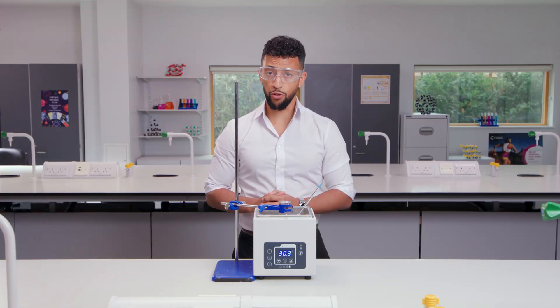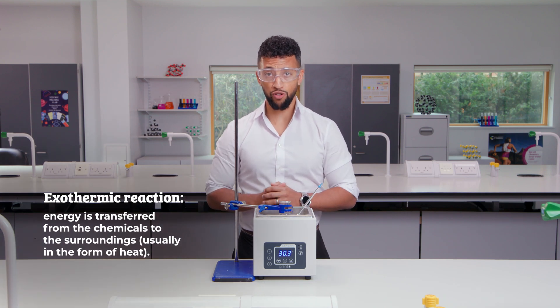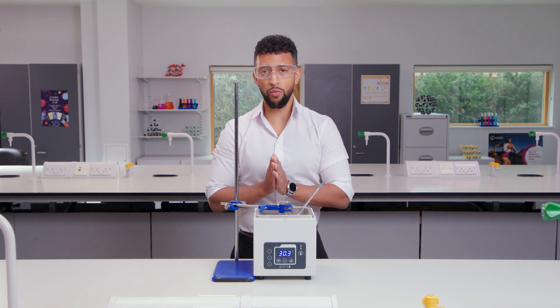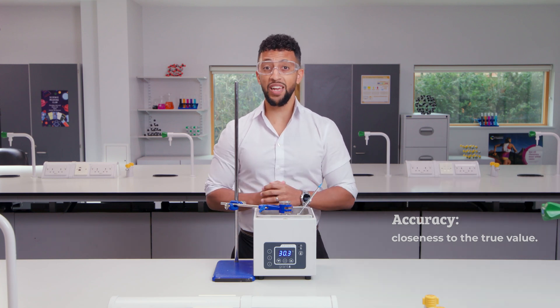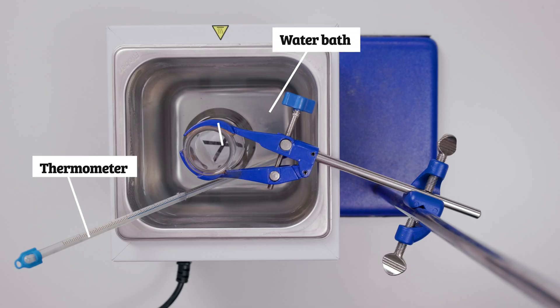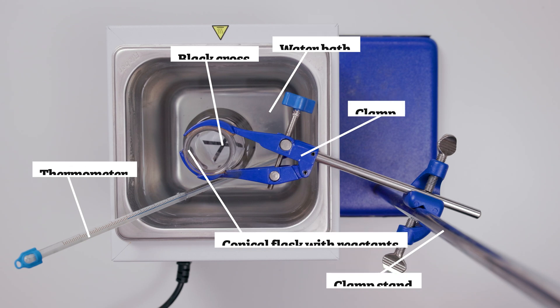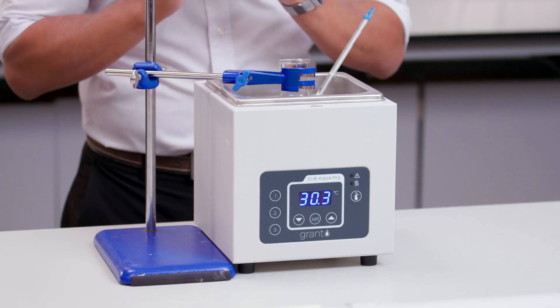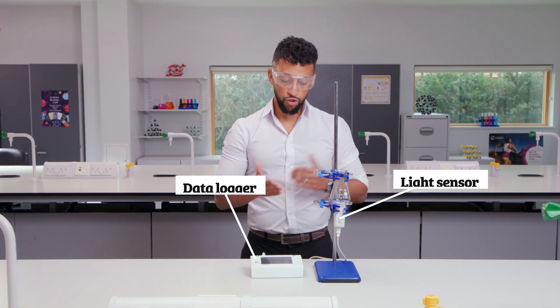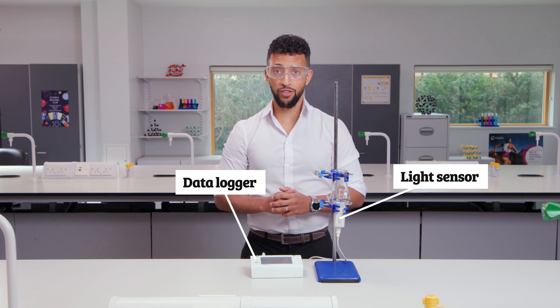This reaction is exothermic, so it may affect the temperature and accuracy of your results. To better control the temperature and improve accuracy, we could do the experiment in a water bath. Keep the temperature constant and below 50 degrees Celsius to limit the toxic sulfur dioxide gas released.